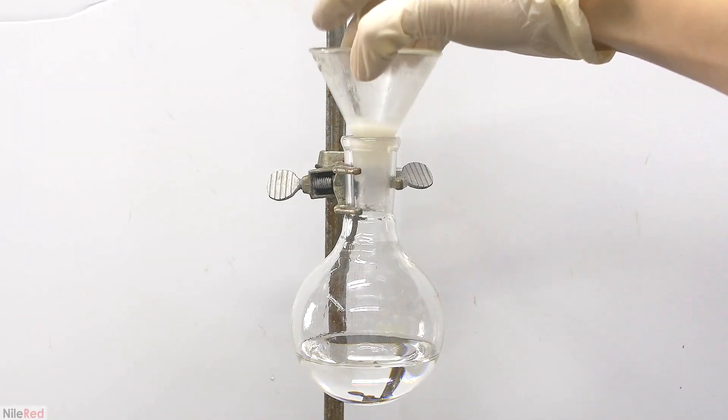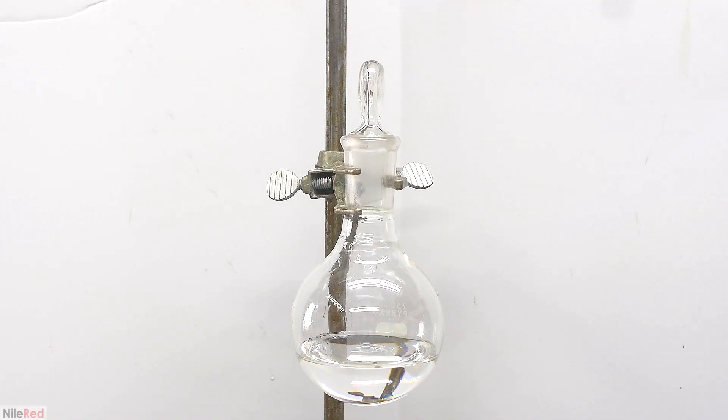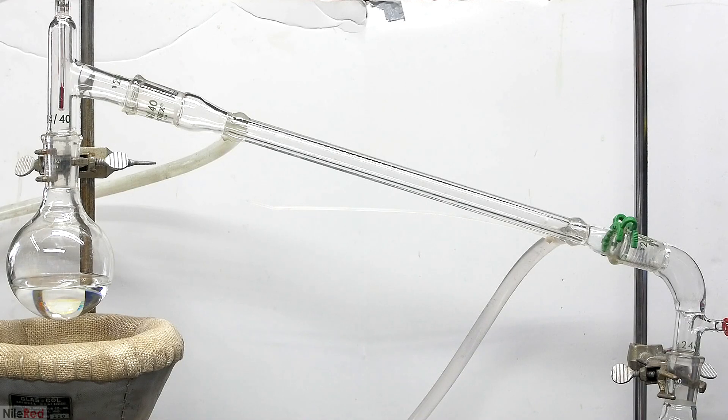The next thing that I need to do is a vacuum distillation, but I want to limit its exposure to air while I set things up. After I've set everything up, this is what the final apparatus looks like.